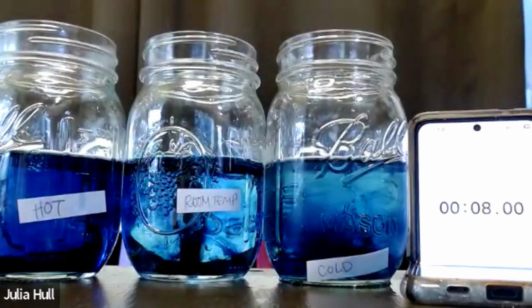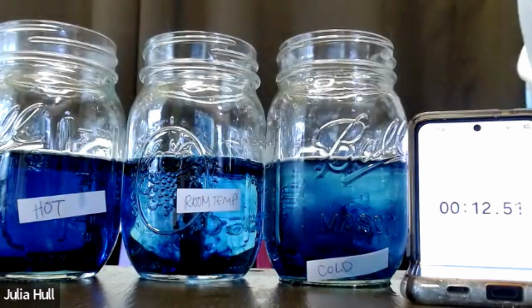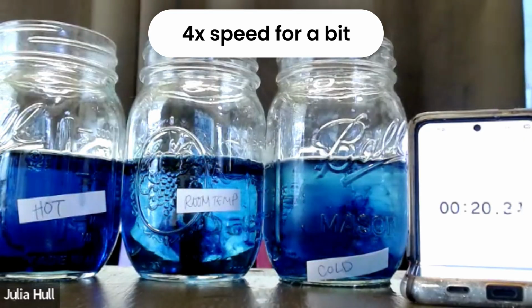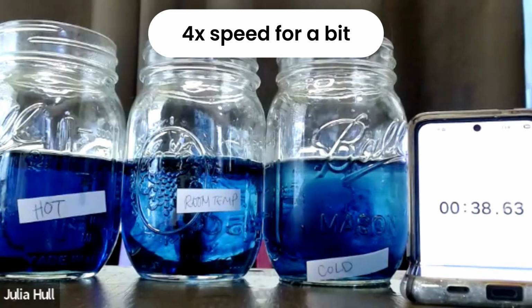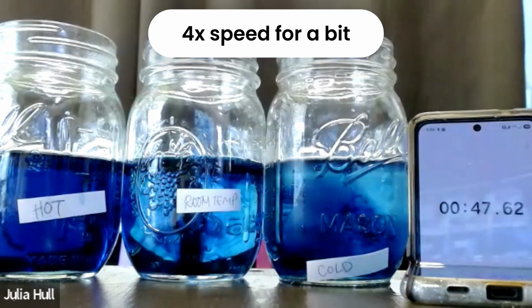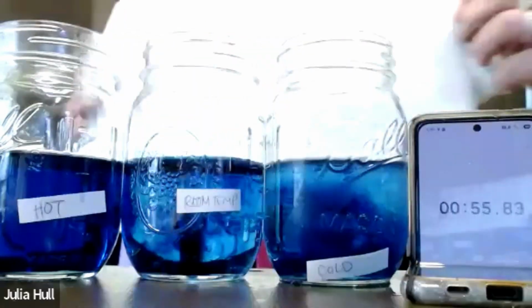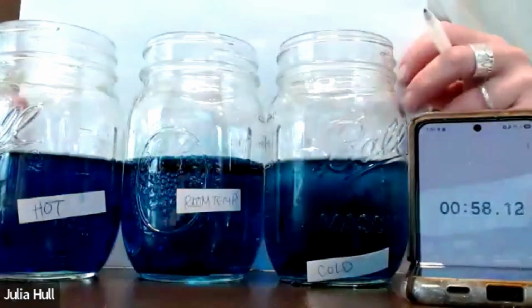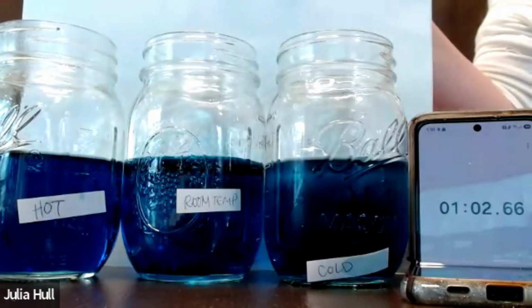Now it looks like my hot's already done. So that was like 7 seconds. The cold looks like it's getting there, but I can still see. Yeah, I'm going to call it for both of those. Now I'll do this 2 more times to get my 3 replicates.